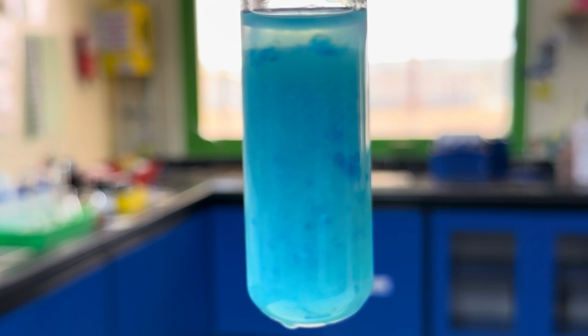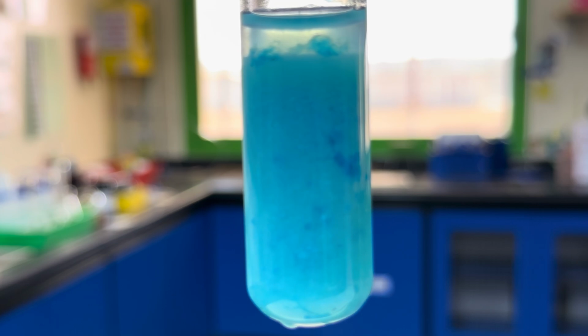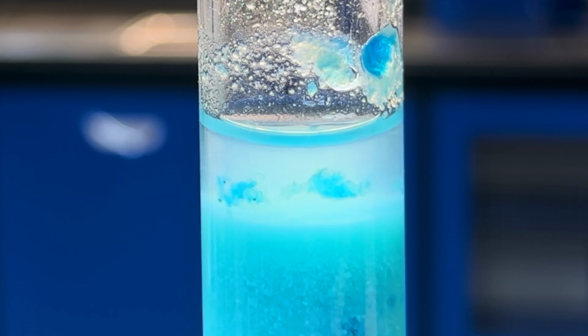So it's turned a lovely light blue colour now, and basically what has happened is that 2 of the 6 water ligands around each of the copper-2 plus ions has been replaced by 2 hydroxide ligands in this chemical reaction. So we've got this pale blue precipitate, but now what we are going to do is add some ammonia solution. Now, ammonia is going to interact further with this precipitate. So I'm going to add the ammonia dropwise.